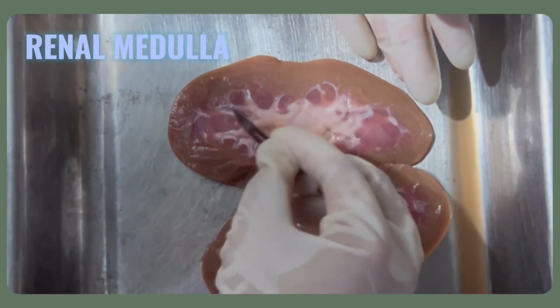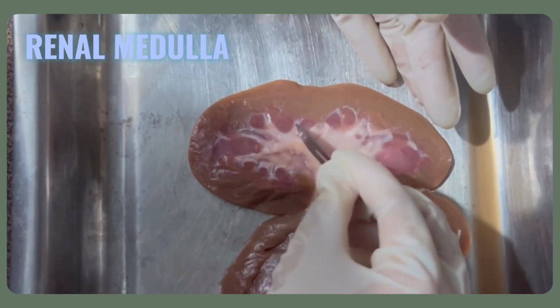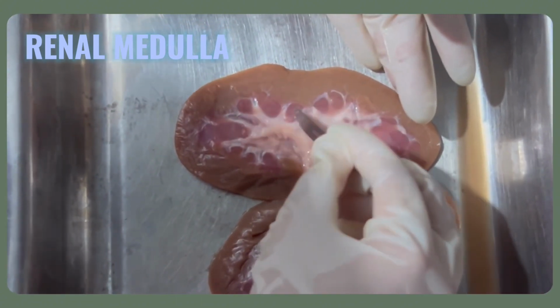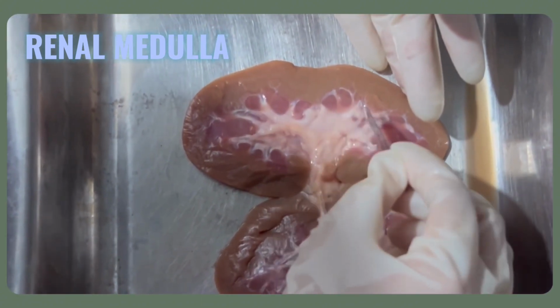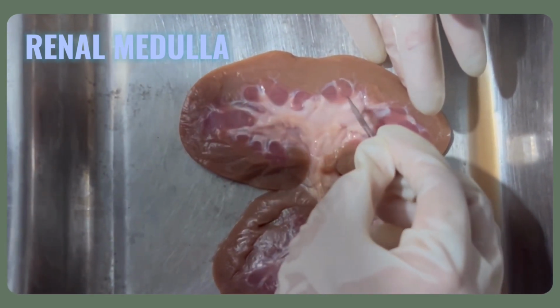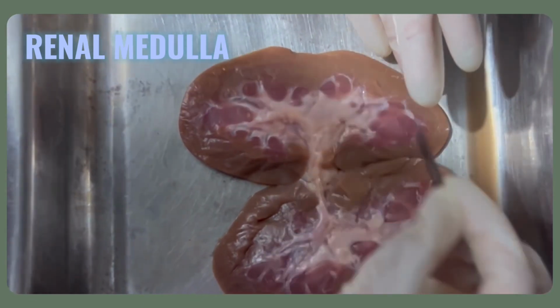Next is the renal medulla. The renal medulla is the region located inward from the cortex. It includes the cone-shaped renal pyramids. These are the fibrous or striped triangular zones in the medulla that contain the collecting ducts, which collect urine from the kidney tubules of the nephrons in the cortex.